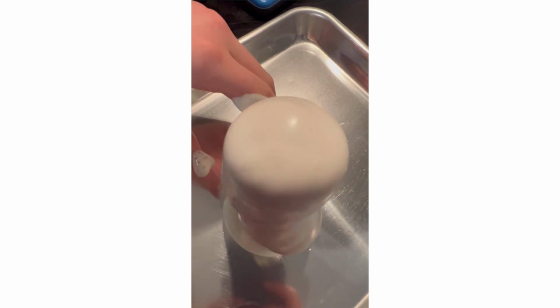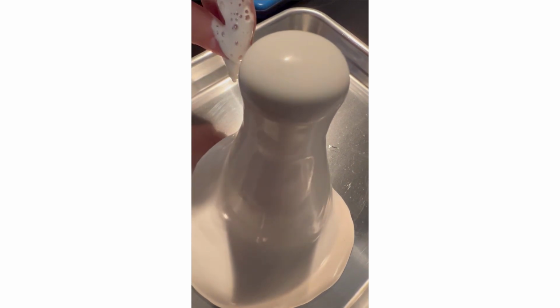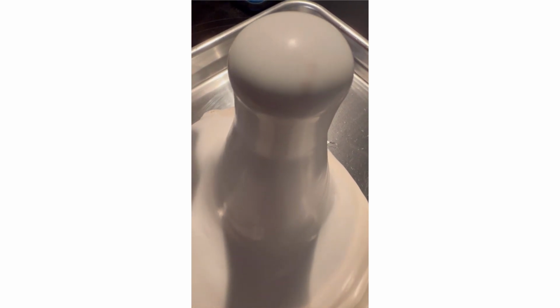This is trial E. Wow, that is rapid. And most of it went out.